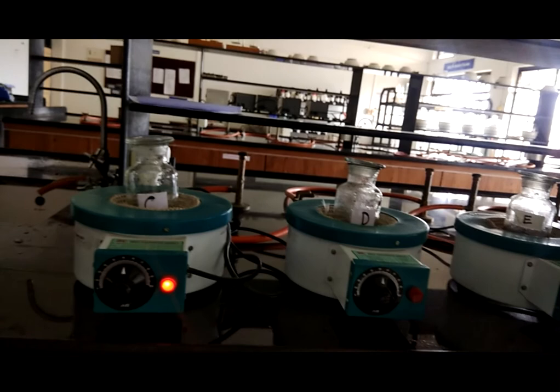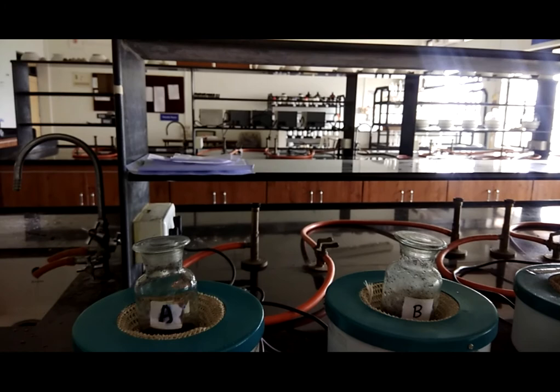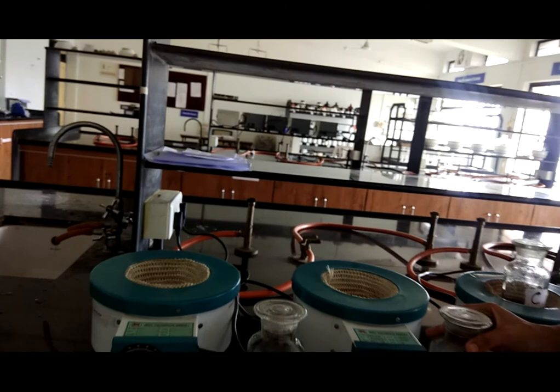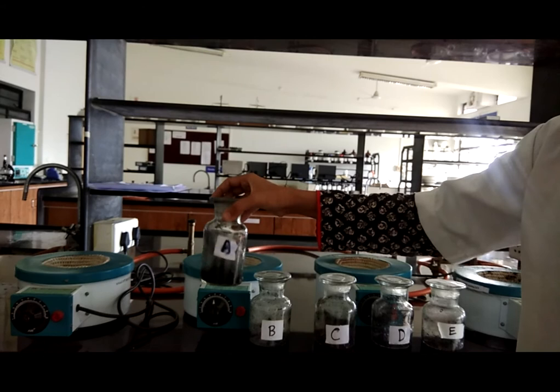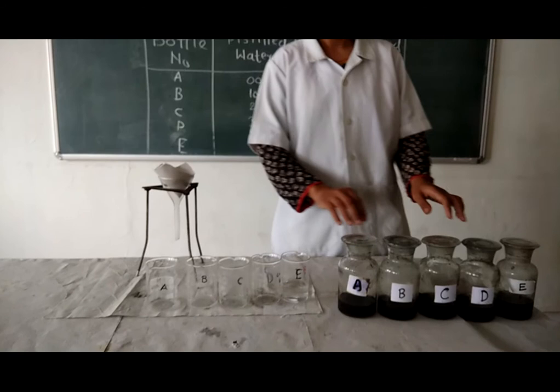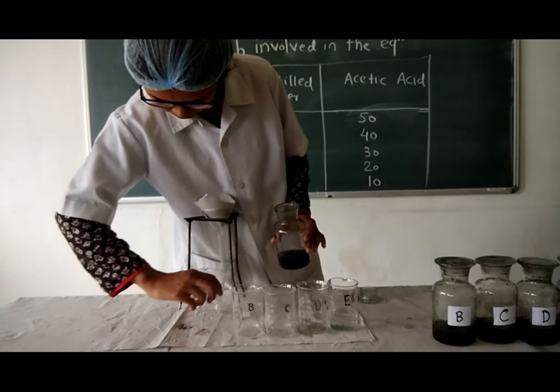Keep all bottles for 1 hour and shake occasionally during the heating process. After 1 hour, remove the bottles from the heating mantle. Now we have finished heating for 1 hour. Cool the bottles to room temperature, then filter the contents. Label your beakers as A, B, C, D, and E, and filter the content into the respective beaker.